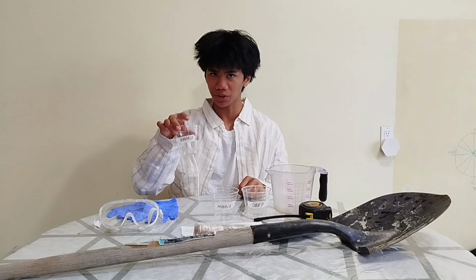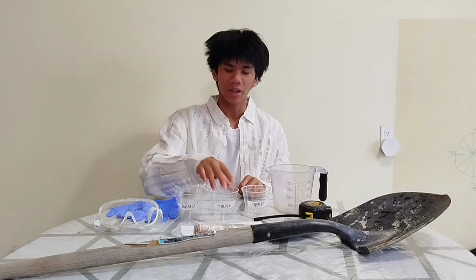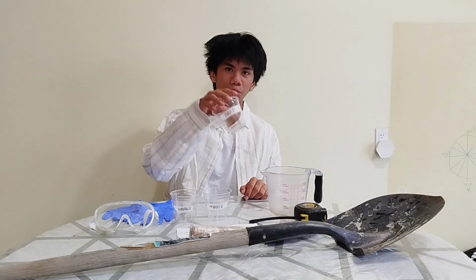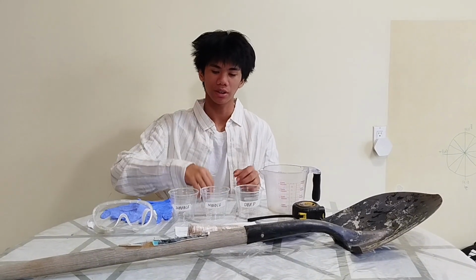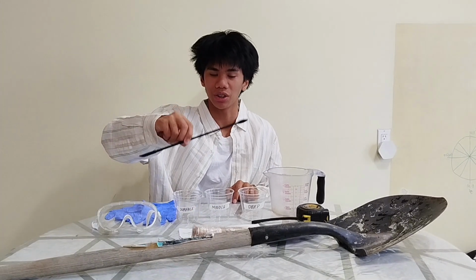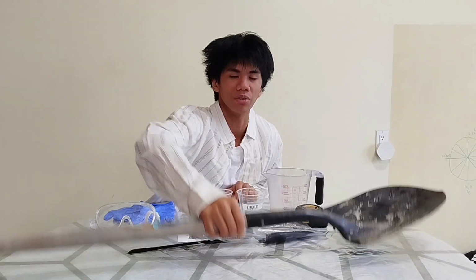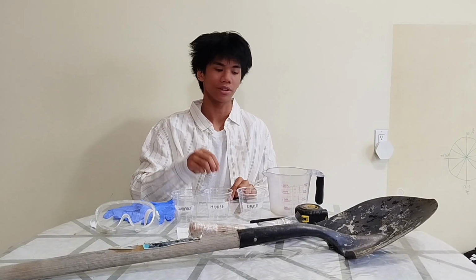Here we have our surface soil, which is just about the top, our middle soil, which is about 1 foot from the surface, and our deep soil, which is about 2 feet from the surface. Here we have my paper to help me record my results, my universal indicator to help give me an approximate pH, my mixing spatula to help me mix each solution, my garden trowel and my shovel to help me dig up dirt and get into that 2 foot depth.